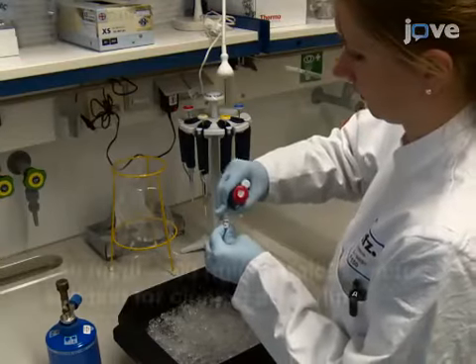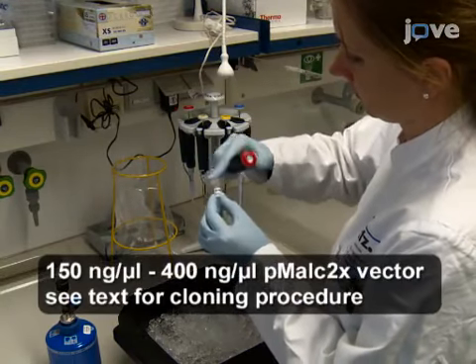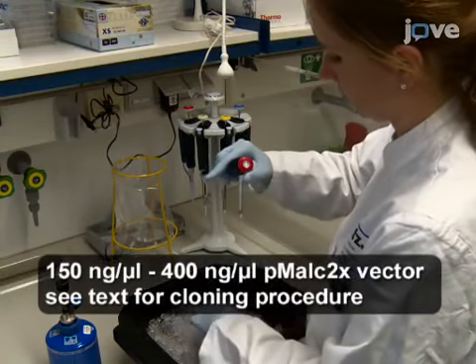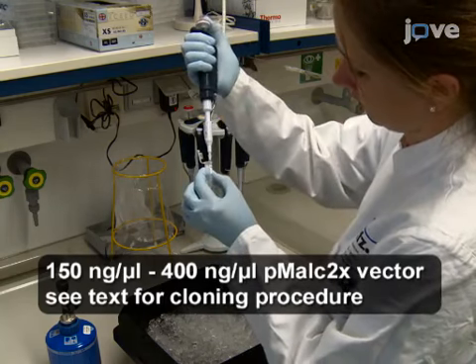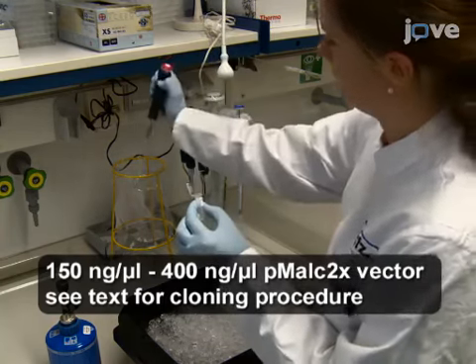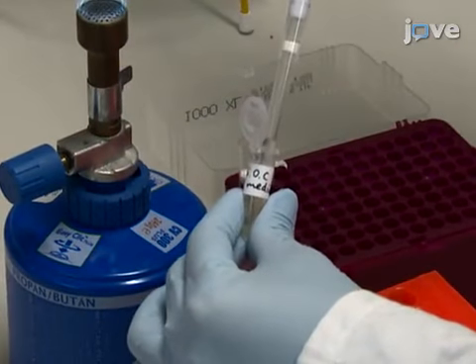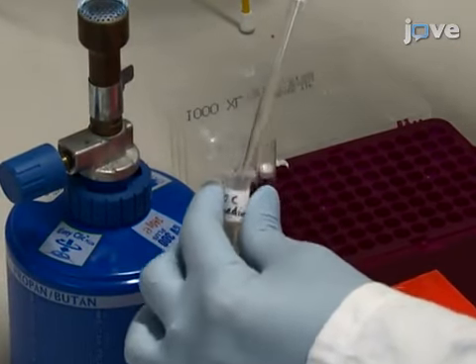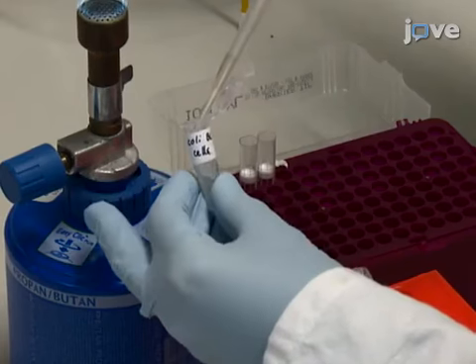To begin, transform 1 microliter of the pMAL-c2X vector coding for the MBP-HisP domain fusion protein into 50 microliters of competent E. coli BL21 cells using a standard transformation protocol. Add 600 microliters of SOC medium to the cells and grow for 1 hour at 37 degrees Celsius.